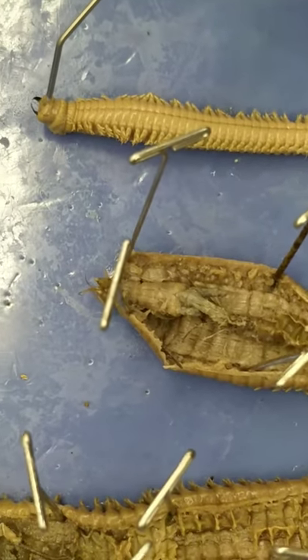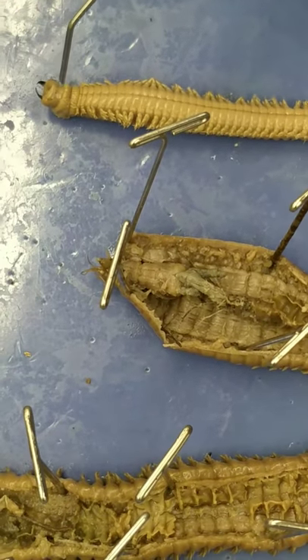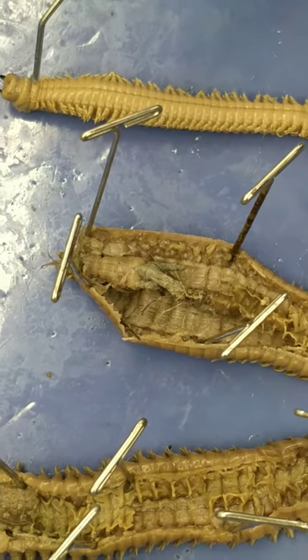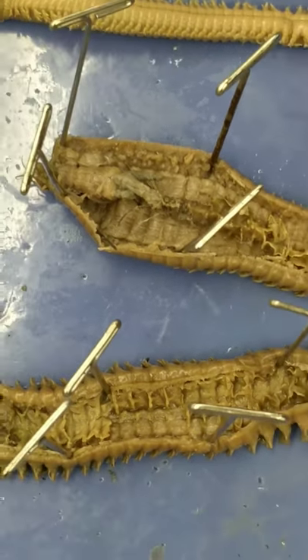This is the everted pharynx, and then this is the prostomium, and then this is the peristomium, here.